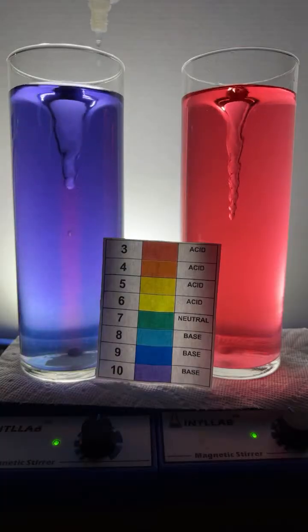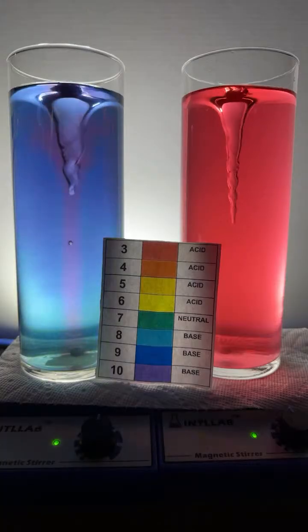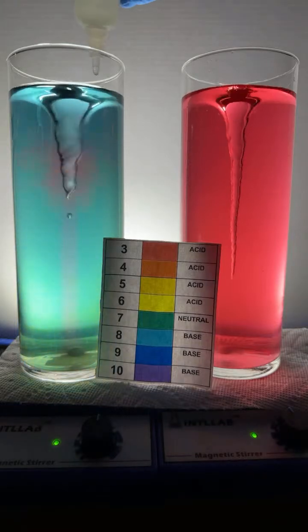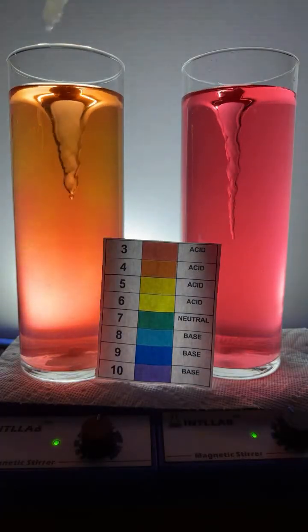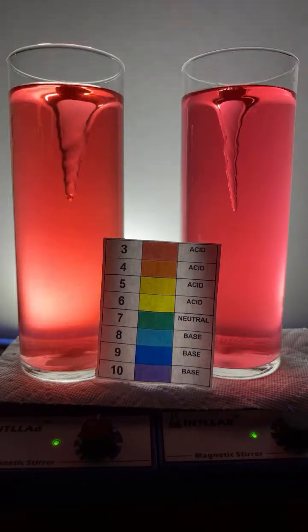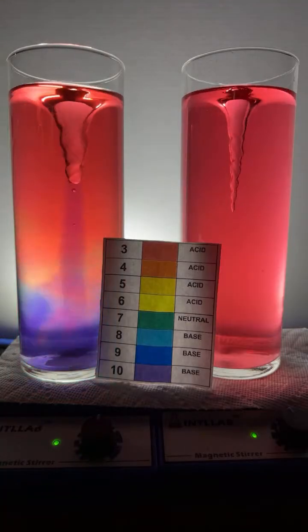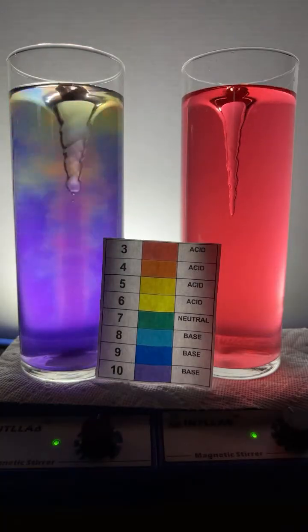Hello there, Ezekiel. There's 3 drops on the left. There's 4 drops on the left. Little flash of colors. 6 drops, 7 drops, 8 drops. All right, let's see if we can get a rainbow action going here. Here we go, baby. All right. 1, 2, 3, 4, 5. Give me a rainbow. There it is. Give me the rainbow, baby.